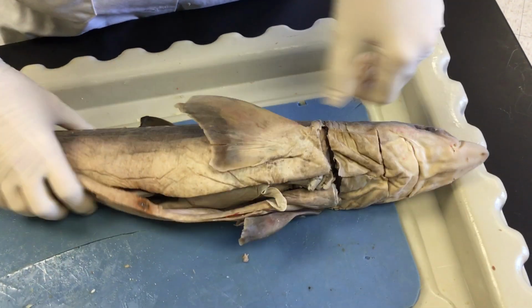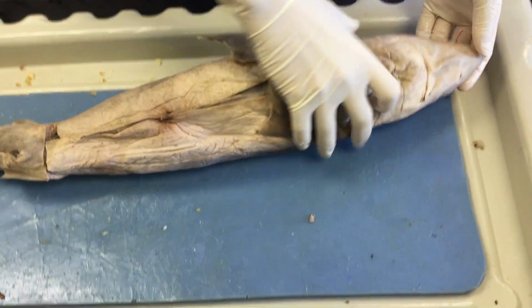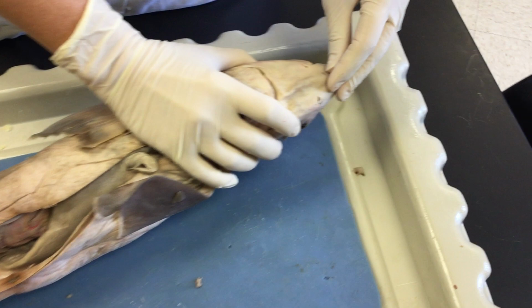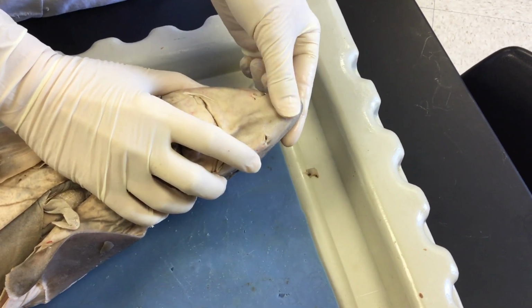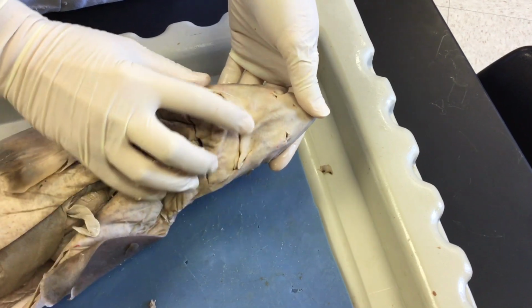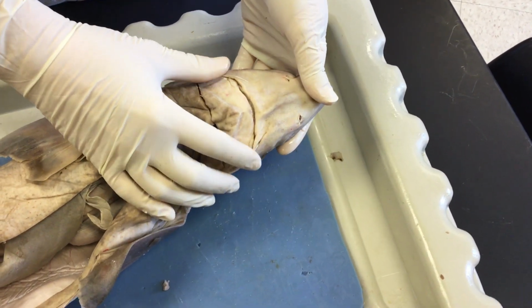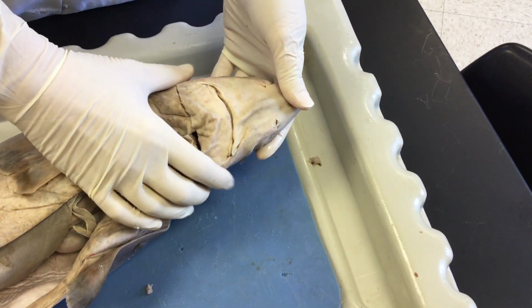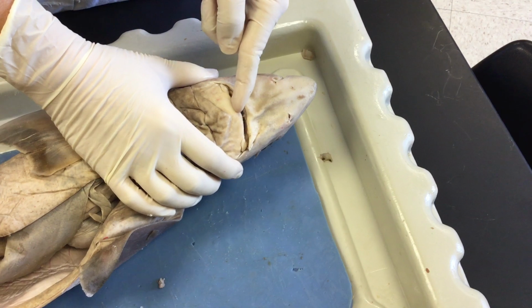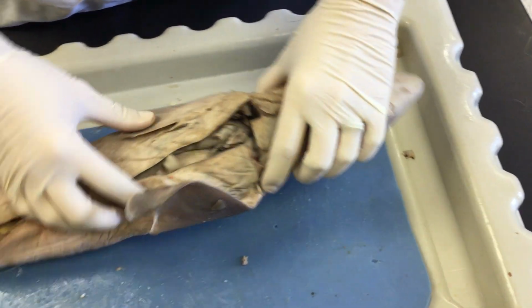So we're going to flip it so that it's dorsal side down, ventral side up. And you can see the nostrils on the anterior region here. So this is the rostrum. Those are the nostrils. All these little dots right here are called ampullae of Lorenzini, and they are little gel-like pits that also pick up stimulus in the water. This is the jaw right here, and so the mouth inside with those ferocious teeth.